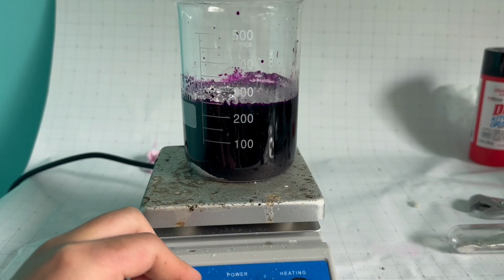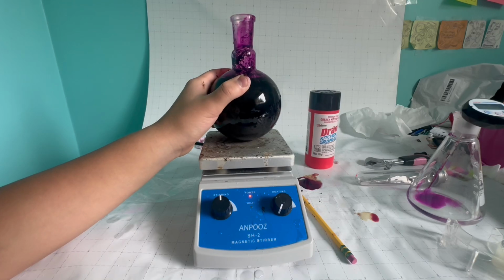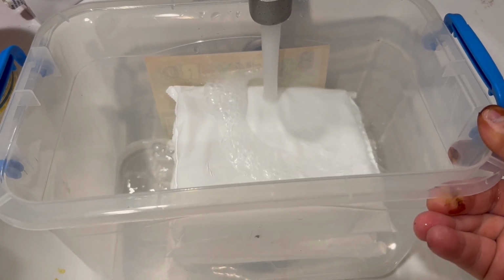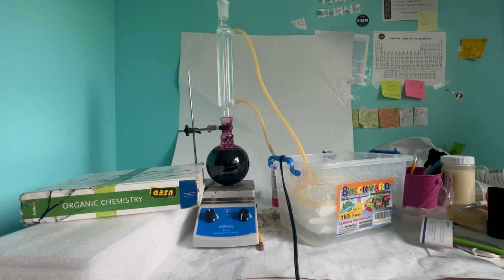Then I realized I used the wrong container and transferred everything to a round bottom. I also introduced a stand and a reflux condenser. I then set up my brand new condensation unit, but it works the same as in the previous video, except it's now vertical. Fine, I'll actually attach a real outlet tube to it. I then let it reflux for around 1.5 hours.